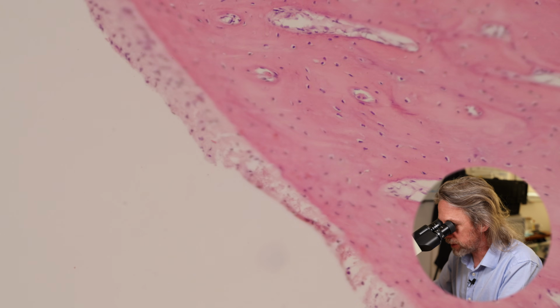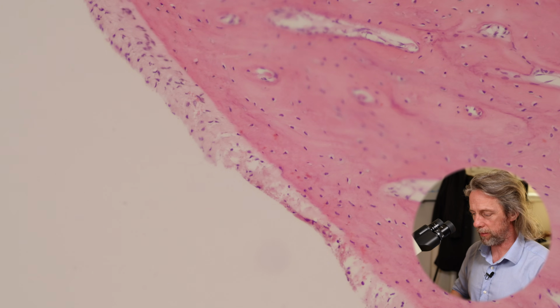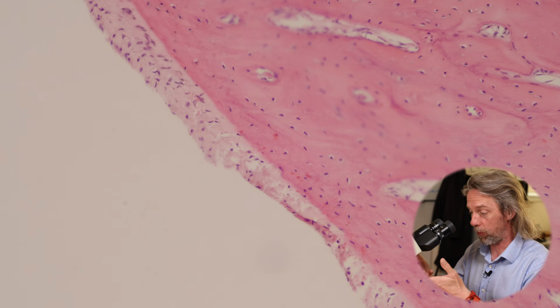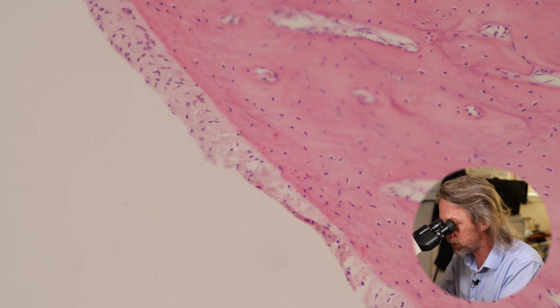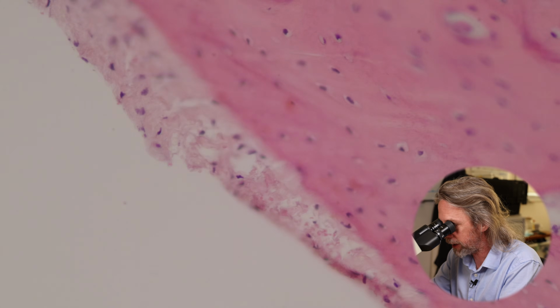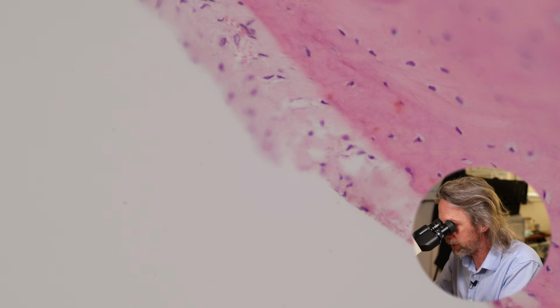Now, I hope that wasn't too out of focus. It's difficult to get the camera focused on the low powers. So that was looking at this with a low power objective. That was 4 times objective lens, 10 times to my eye, 40 times. Now I'm looking at 10 times objective lens, 10 times to my eye, so 100 times magnification. Let's jump up again, so 200 times magnification to my eyes. Oh, it's a bit of a wrinkly section. Yeah, that's bone for you.